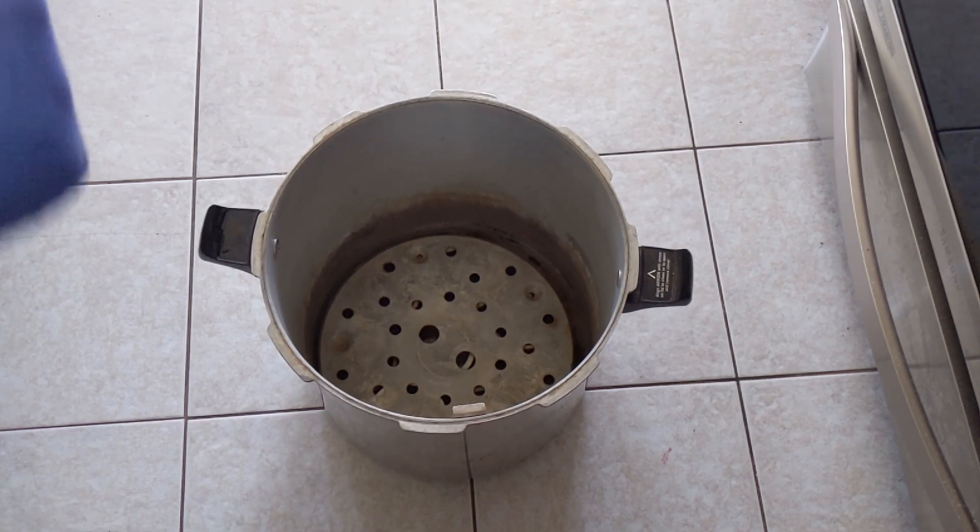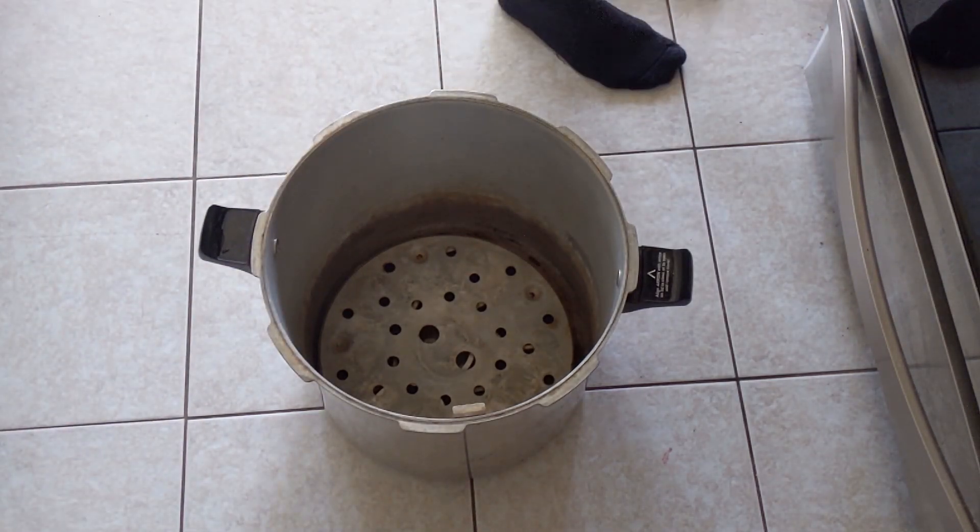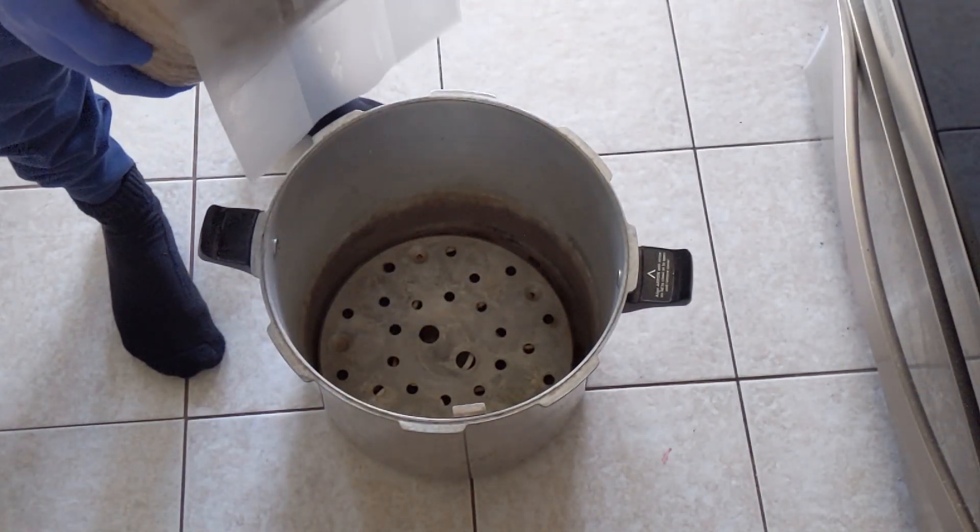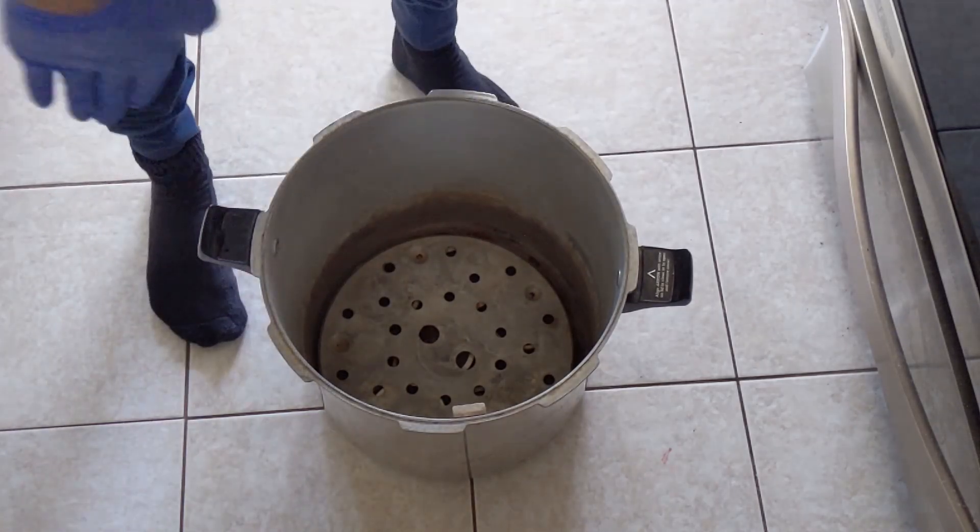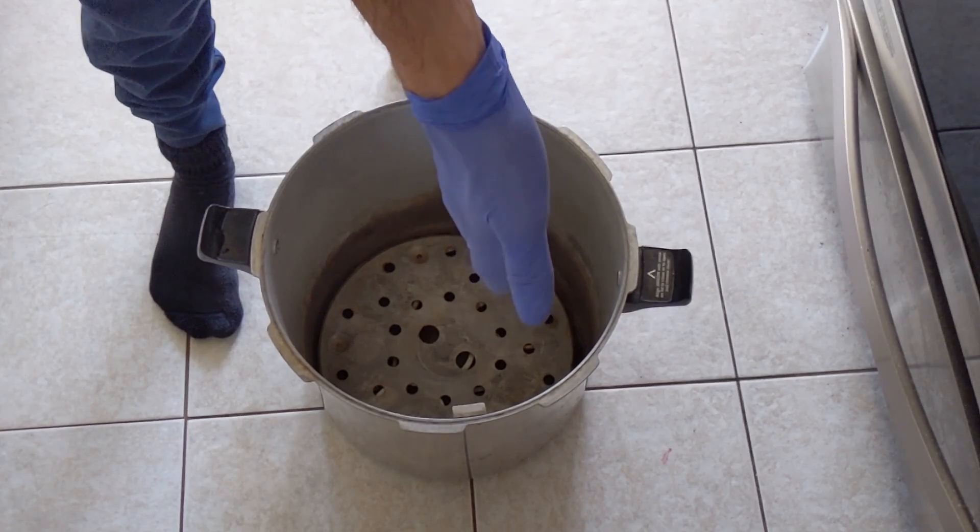I show how I fold the bags under, but I actually fold the first ones with the bottom. They need to go this way, they need to go horizontal. The bottom ones, and then I like to have the top ones vertical.